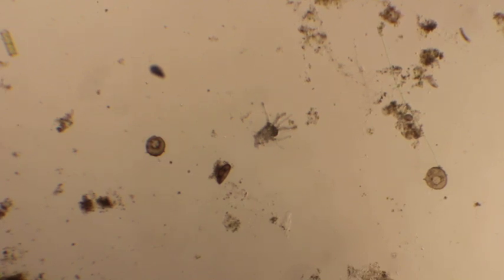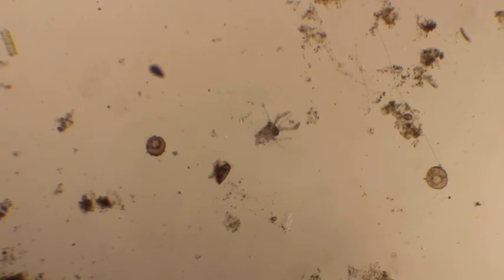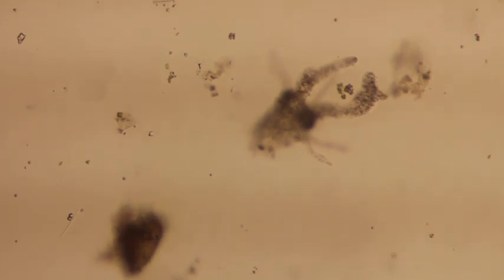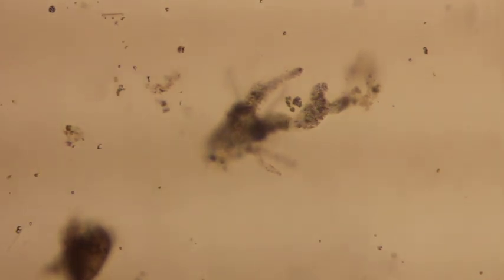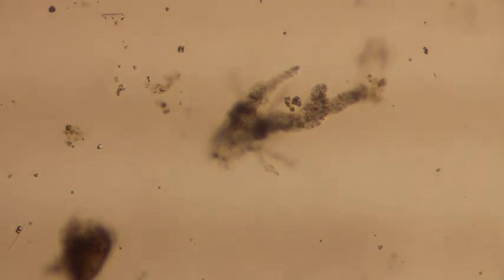You can see other things moving all around. The amoeba actually is not moving very fast. I'm going to take the 4x and shoot up to the 10x and focus it. There's our amoeba. We'll move our amoeba right into the center. Amoebas are very interesting in pond water because in pond water you have all of your various levels of an ecosystem.